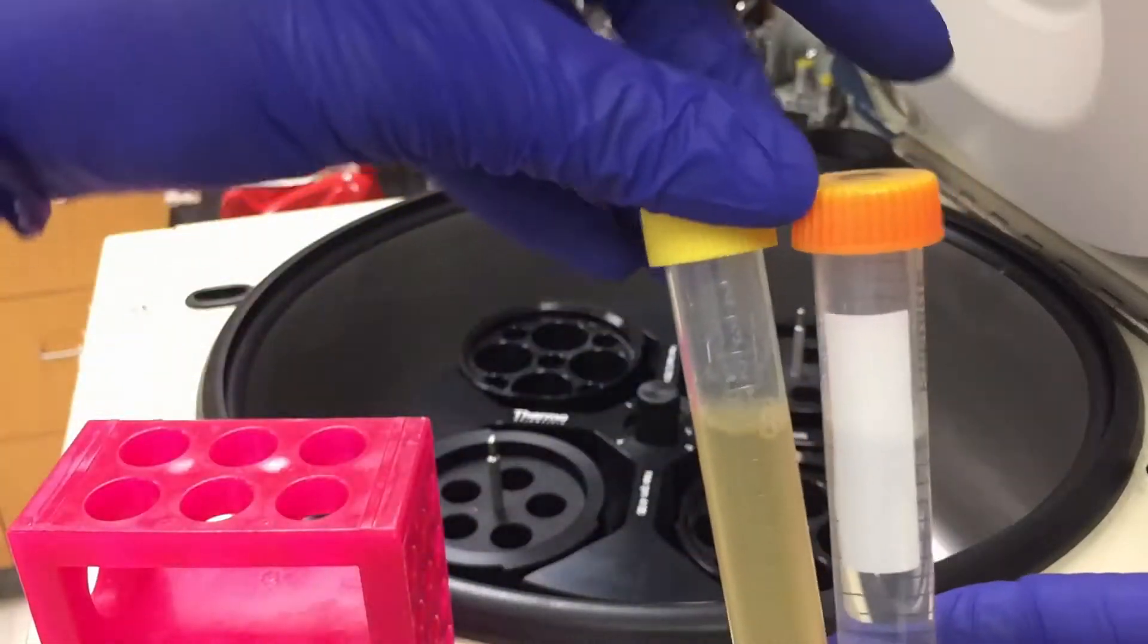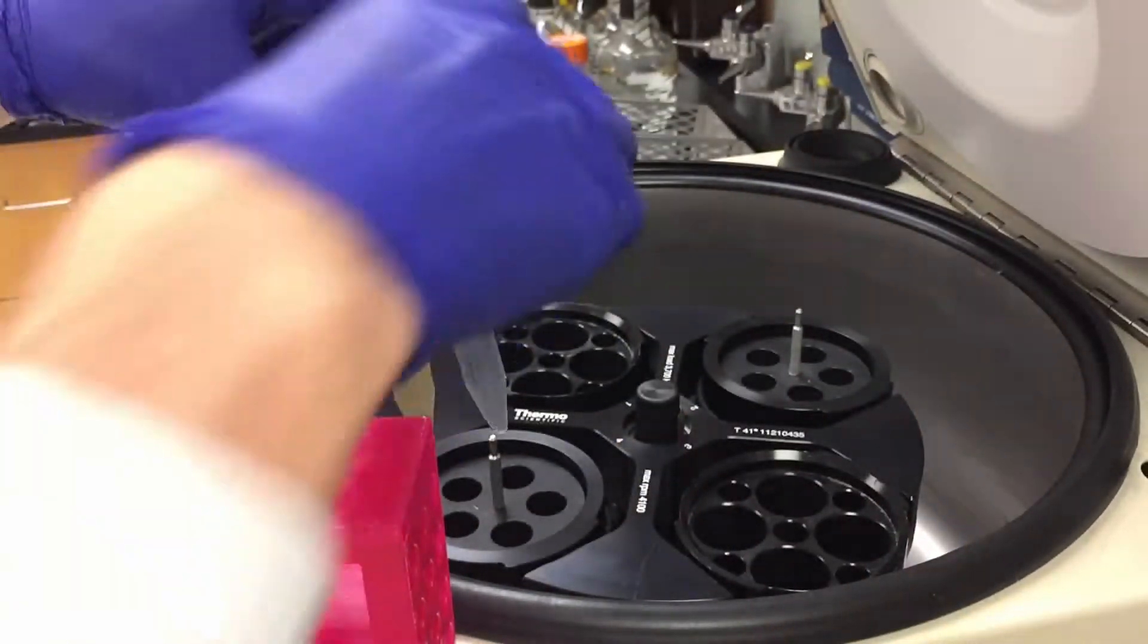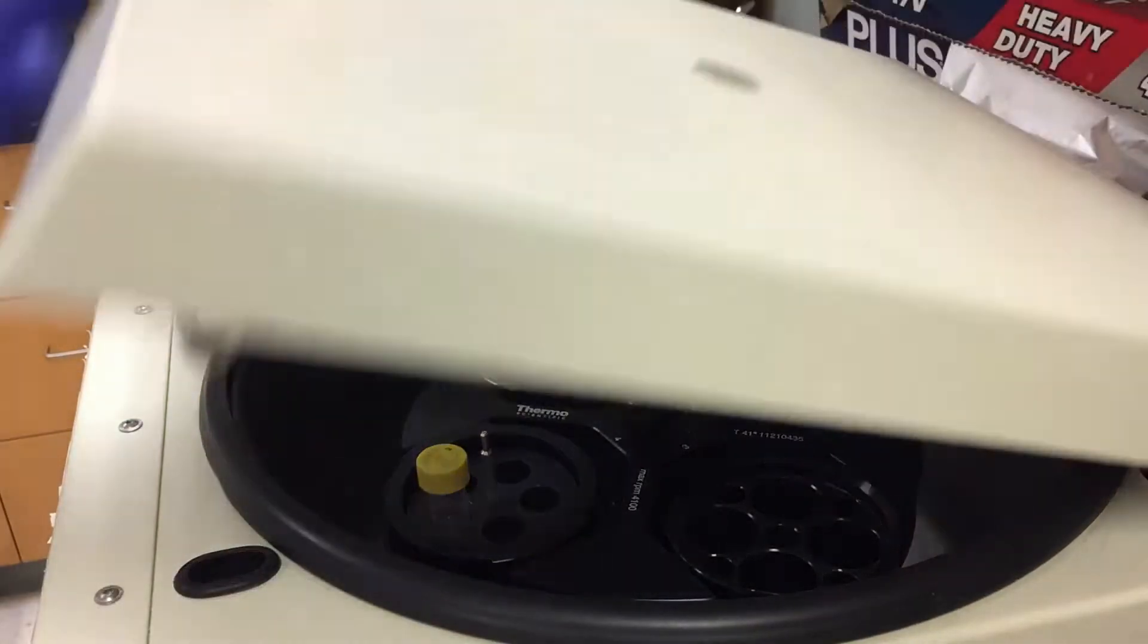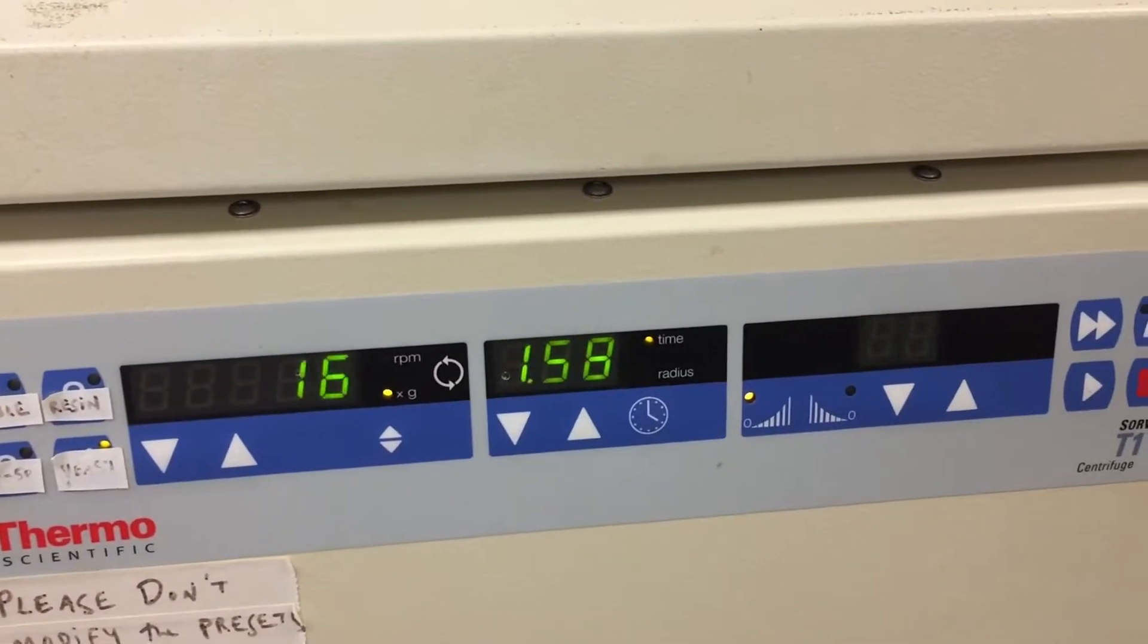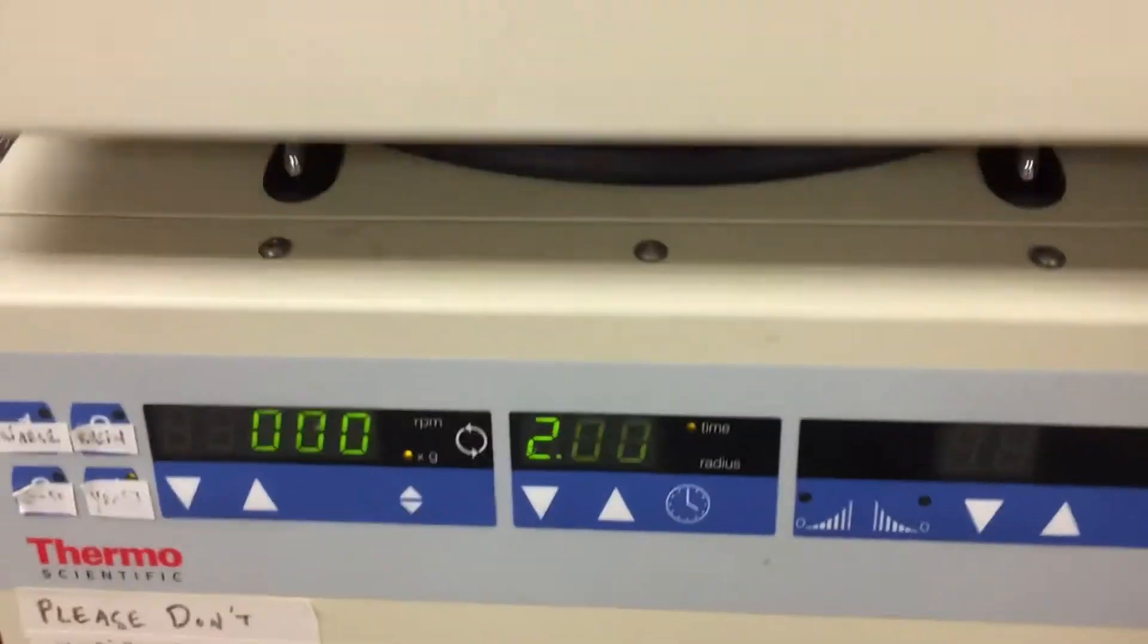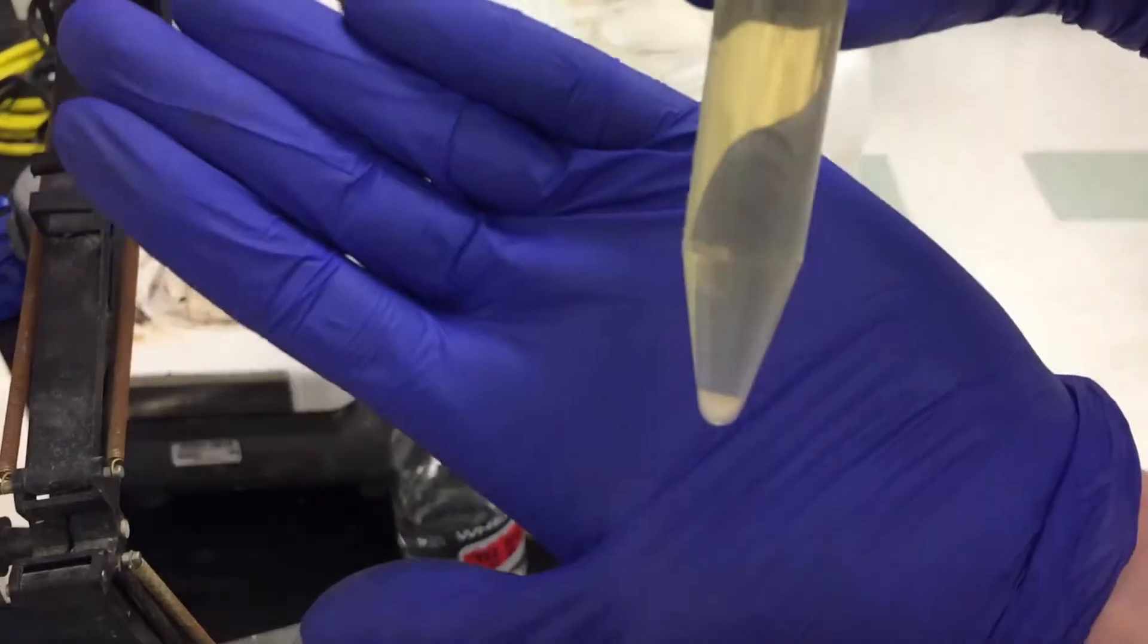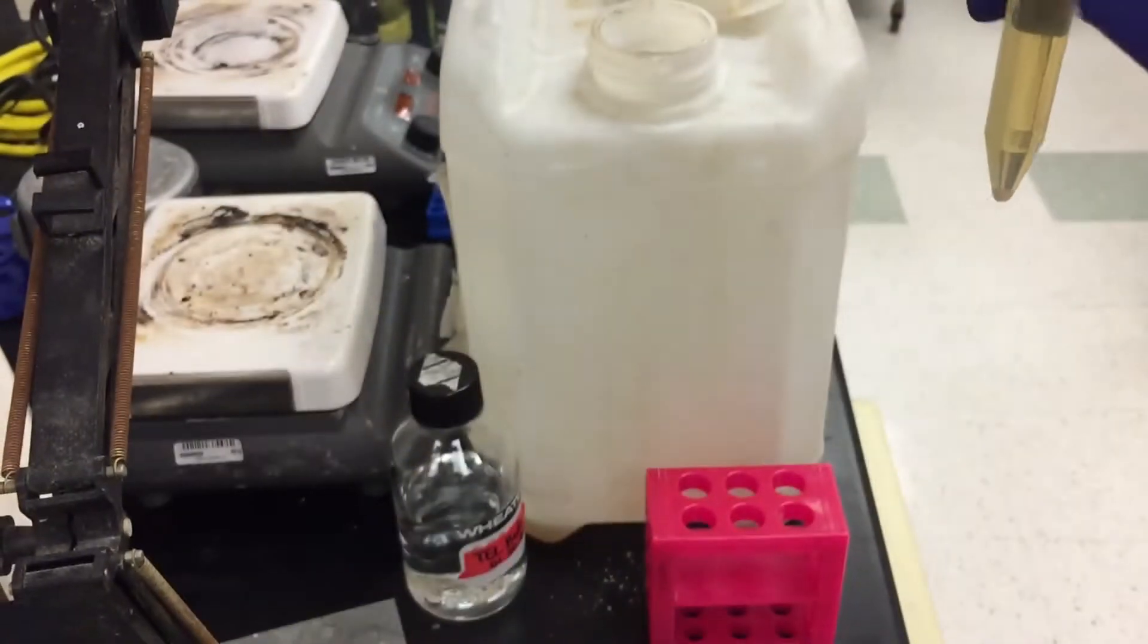Harvest the cells by centrifugation. Pour off the media and wash with Tel Buffer.